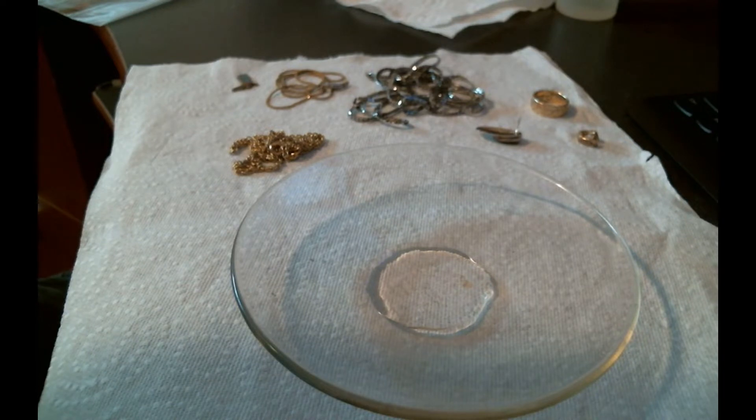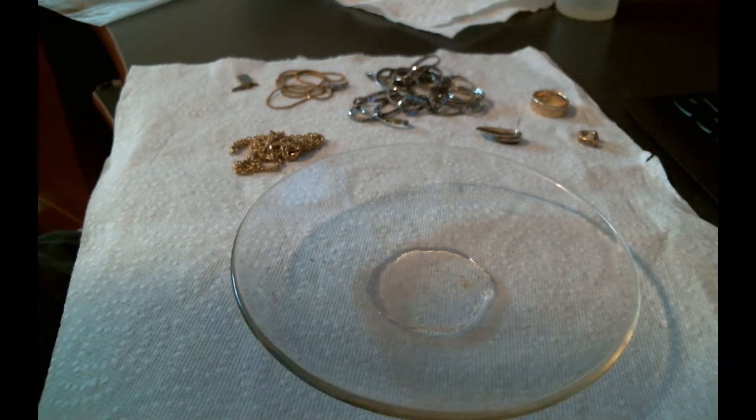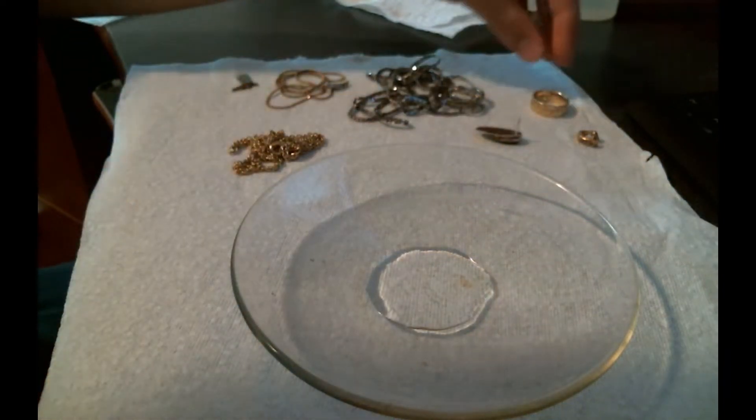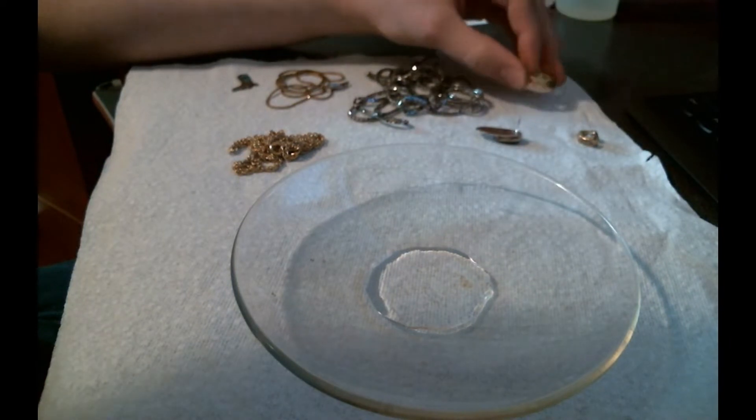We're going to do an example of each of the things. The purpose of it is to screen out items. If you're buying a selection of gold objects, you might think something is gold and it turns out that it's not.